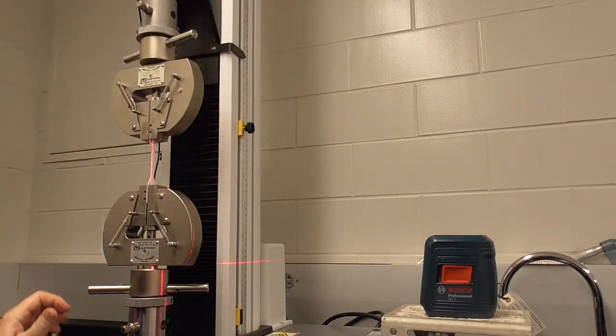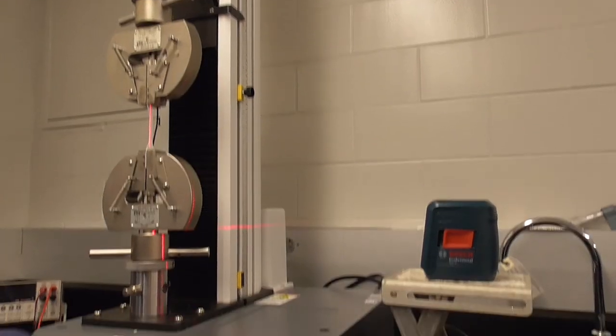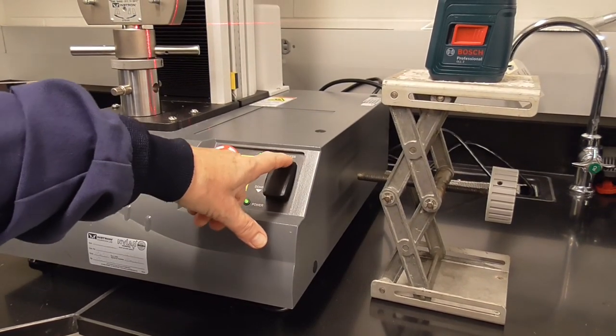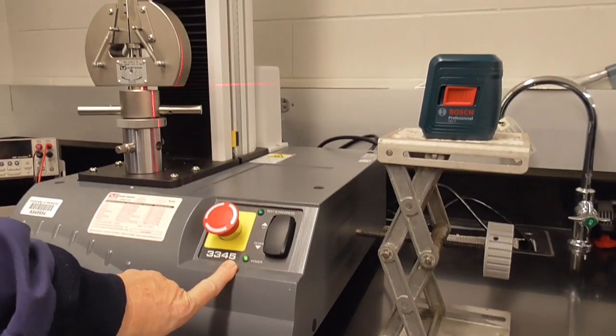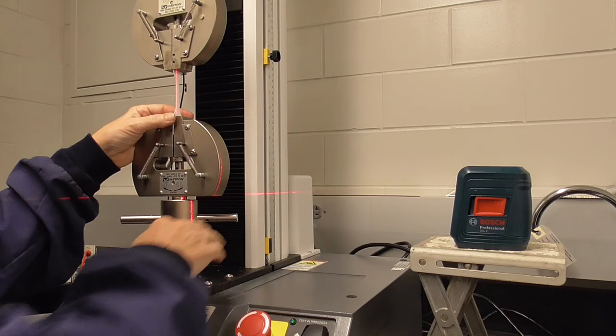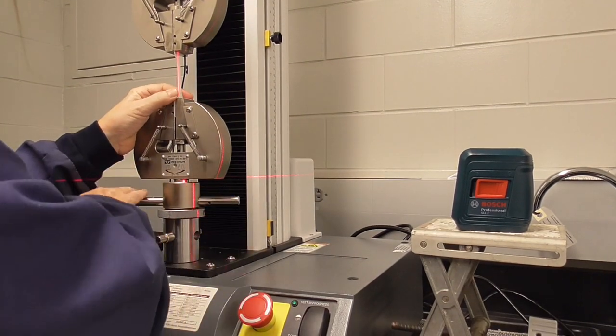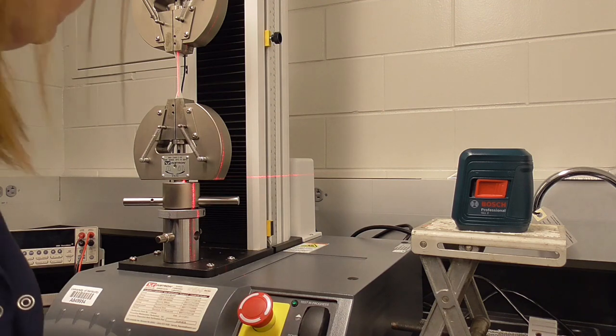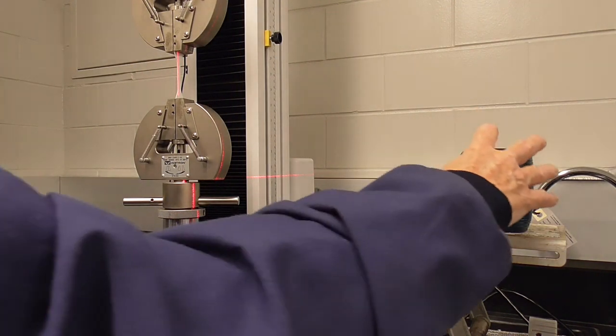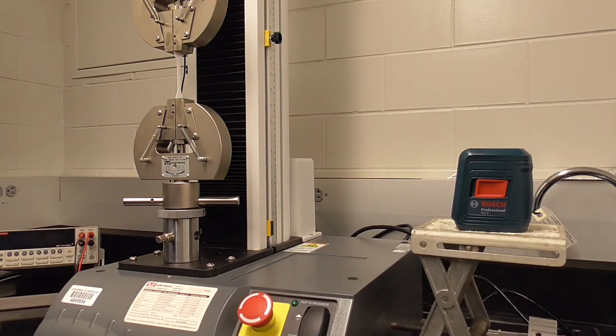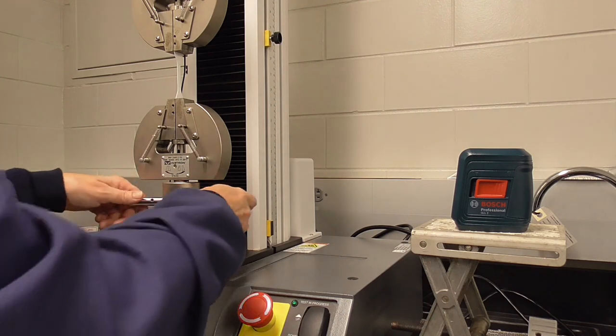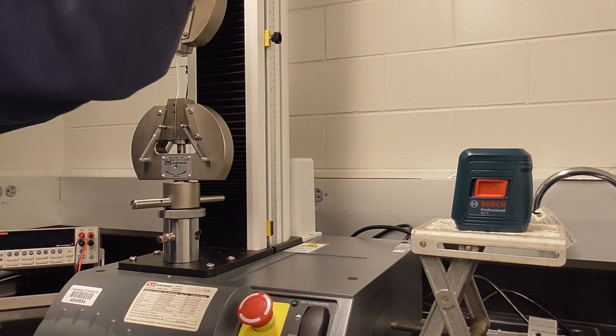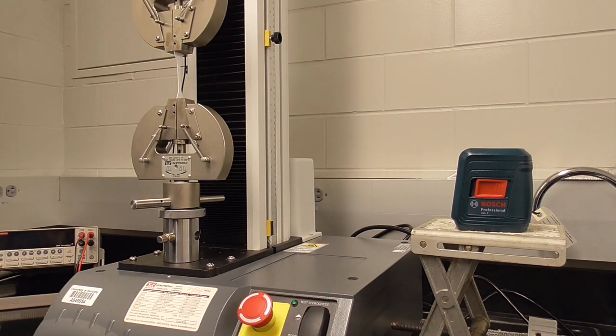If the length isn't quite right, I'm going to jog using this jog button up or down depending on what I need. The laser is pretty straight so I have to hit this knob button about three times to turn it off. Now I'm going to snug up this grip and I'm ready to go do the test.